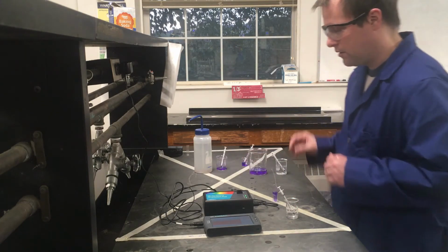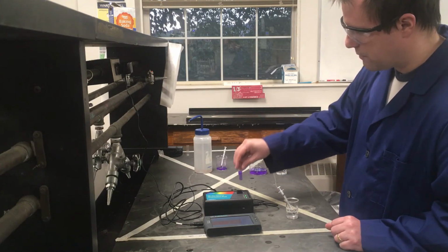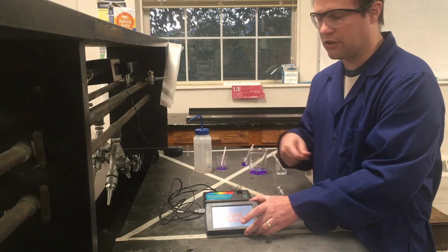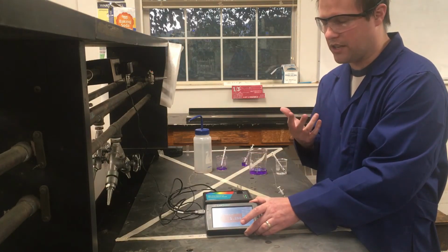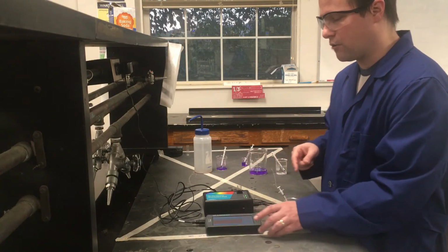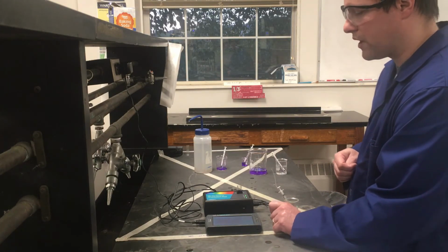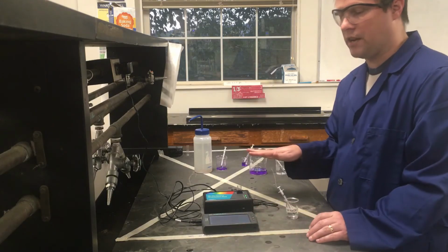But at this point, when I have this ready to go, I can make sure, again, that the slit's lined up properly. I can see my absorbance value. It's actually a little bit less than what my stock was originally. It's a good thing. And we should hopefully start to see this decrease over time. I am going to hit play here on this thing just to start recording. And I'm basically going to let this go for 10 minutes.